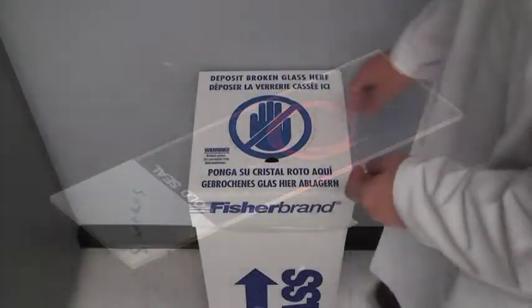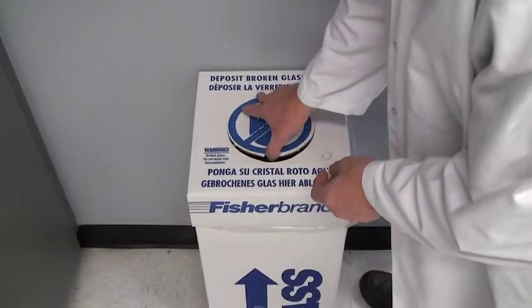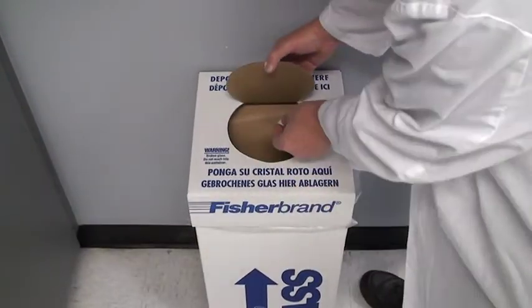When you are done viewing a heat fix slide, dispose of it properly in a glass disposal box.